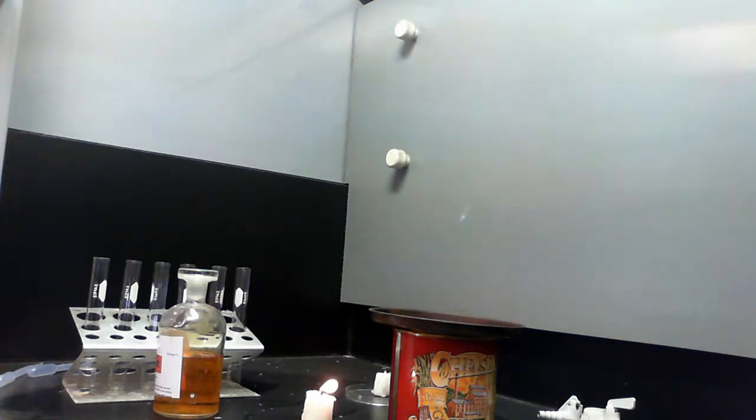If we leave that, I do intend to leave it burning for a while, you'll see of course that it will melt. So there's enough heat energy in that candle to break enough forces between the molecules to turn it from solid to liquid, and then from liquid to gas, and then it's the gas that's going to burn. Alright?